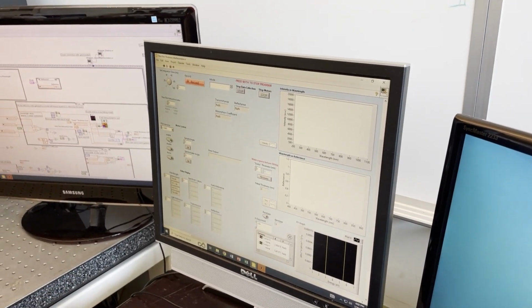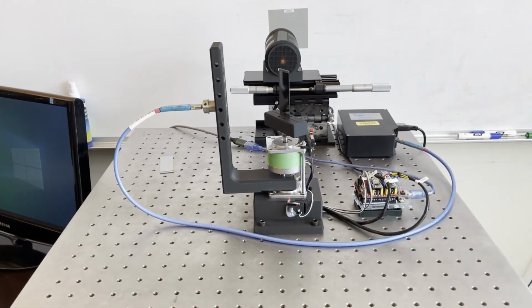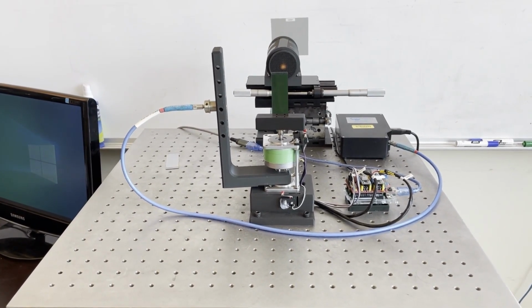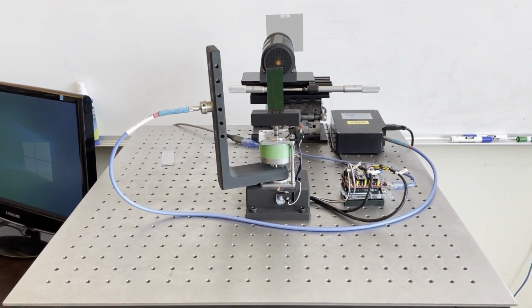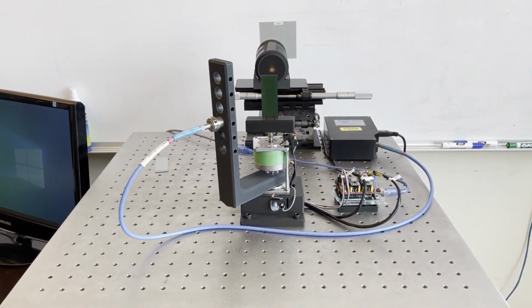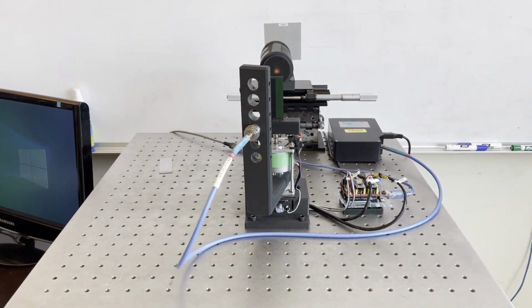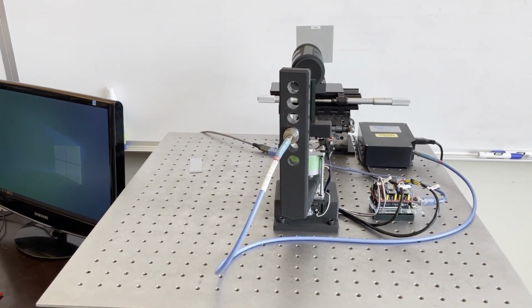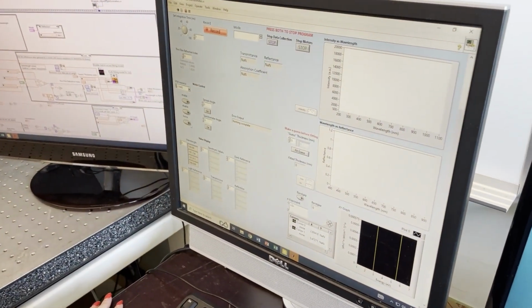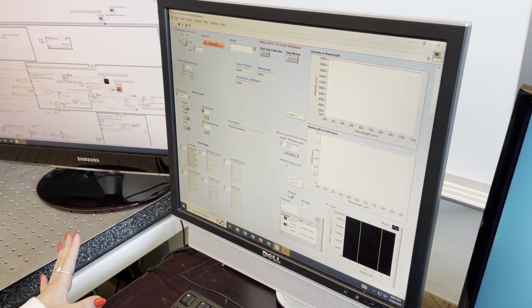Now, once you start it, you're going to want to enable the motors and then home them in order to make sure you get the proper angles. If you don't home them, it's going to think it's at a different angle than it actually is. While it's homing, the light on the home button is going to be green. So wait for that to turn off and for there to be a completion message in the error output before you try and send it to an angle.